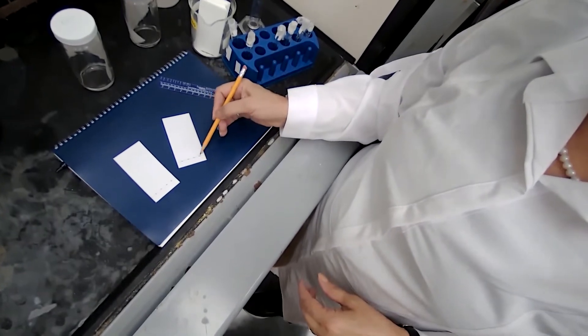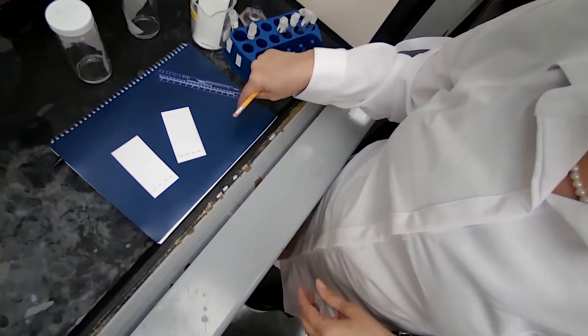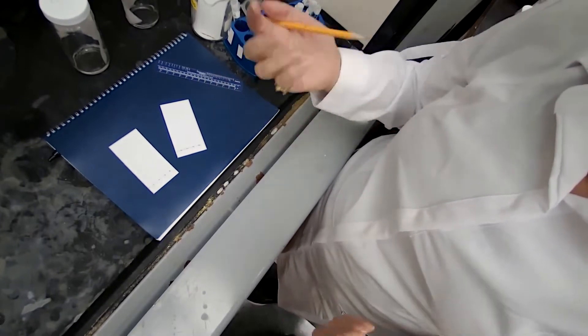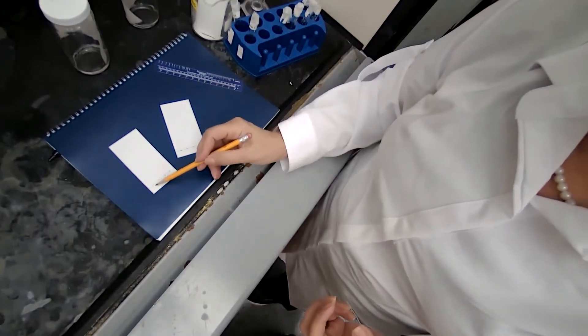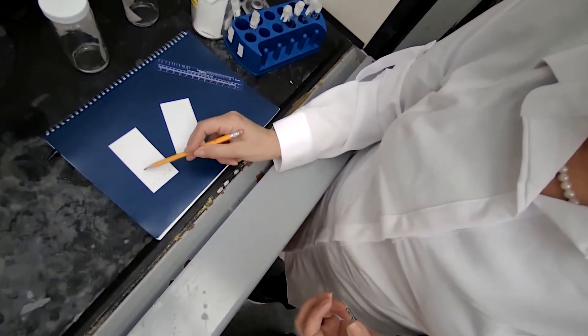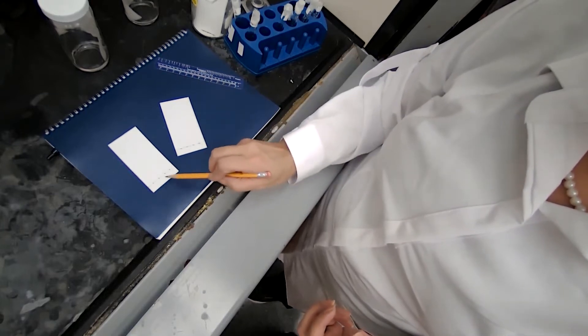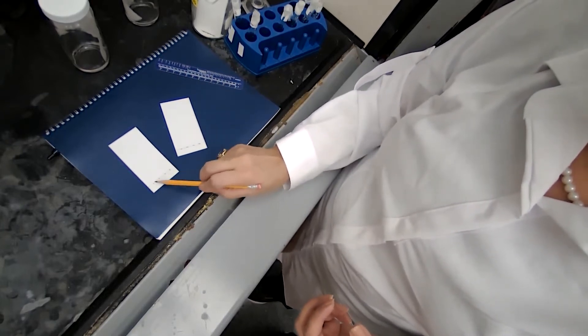I also changed the background so you could see it better through the camera. I made the second plate also, a TLC plate with the line and the spots.